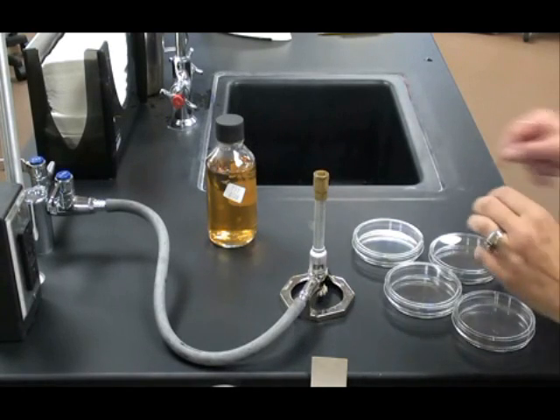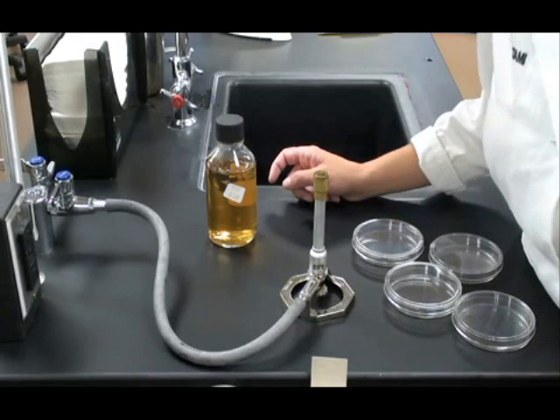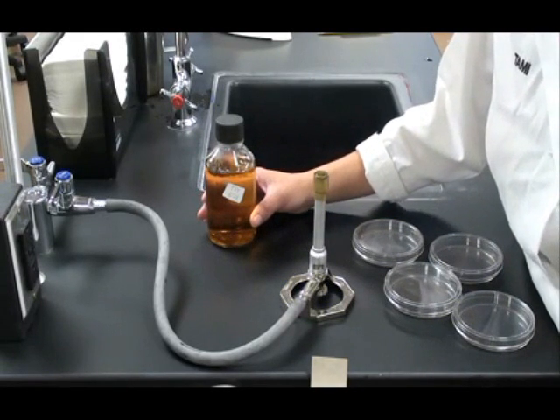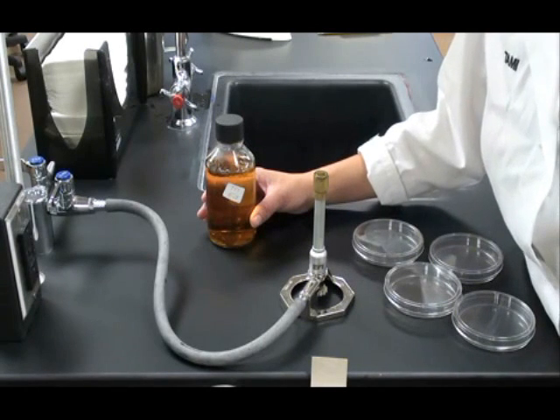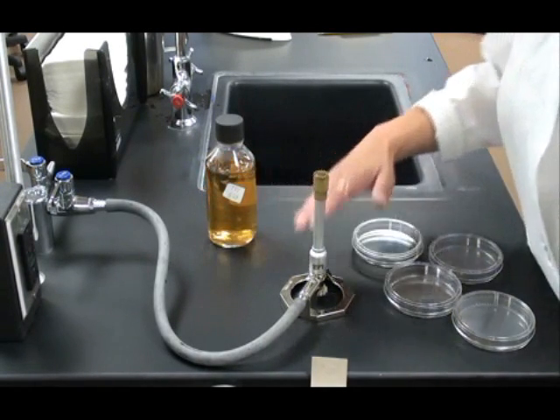In this video, I'm going to show you how to aseptically pour tryptic soy agar bacterial growth media into petri dishes. Before I do that, I'm going to need to light my Bunsen burner in order to sterilize the neck of my bottle.